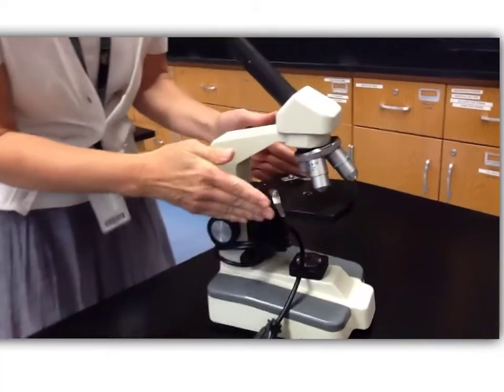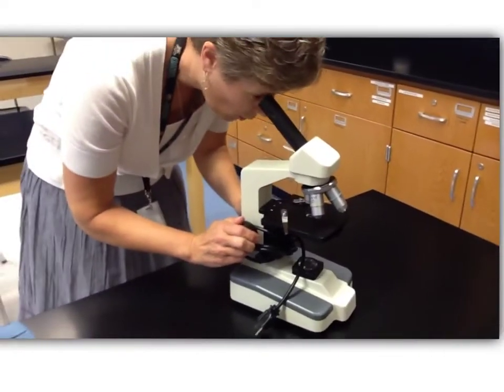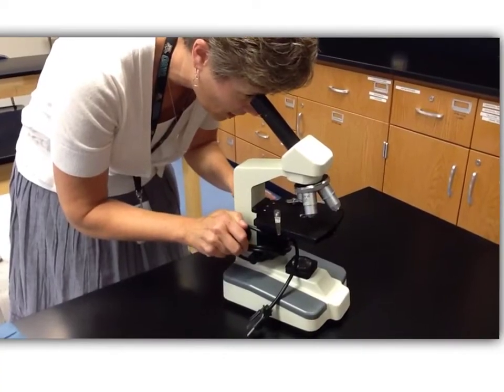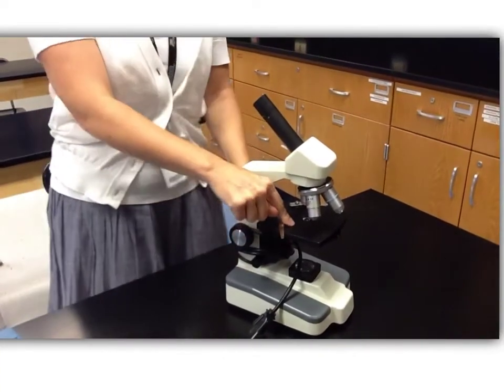But you're going to start with it all the way up, and while you are watching, slowly turn it down until you can see your object.